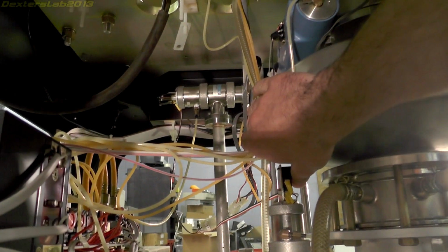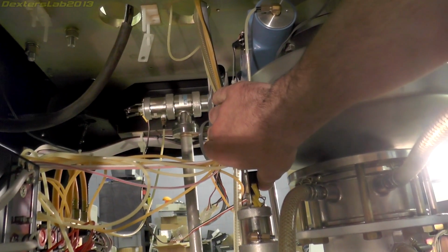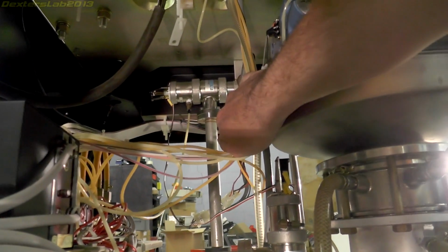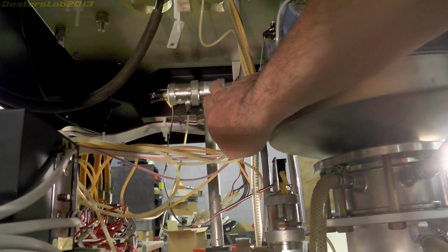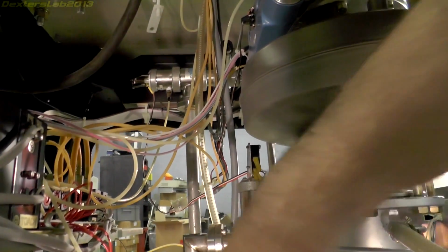I don't believe the sample exchange chamber is brought down to full vacuum, apart from when the airlock door is open. I think it's just brought down to a moderately low pressure. So I think there might be a separate feed off there to another roughing pump.